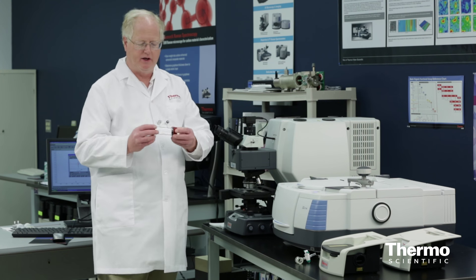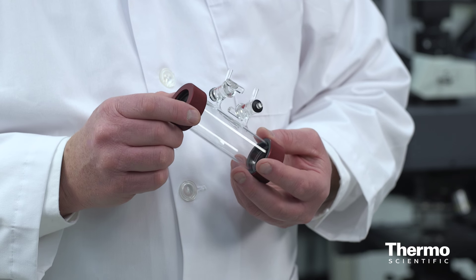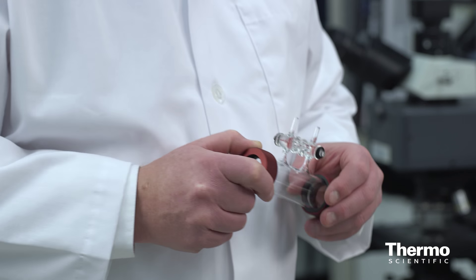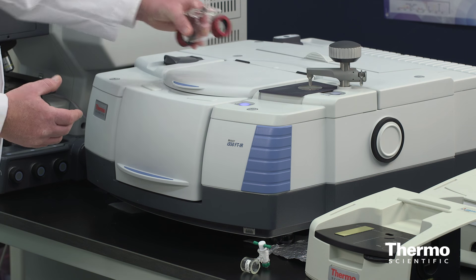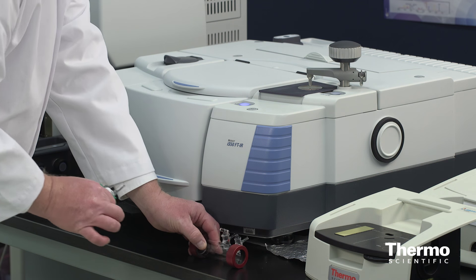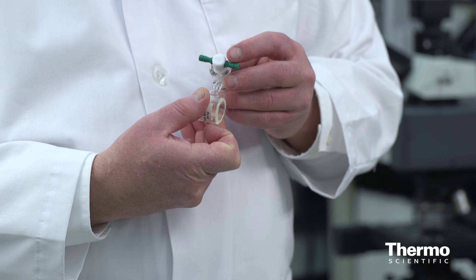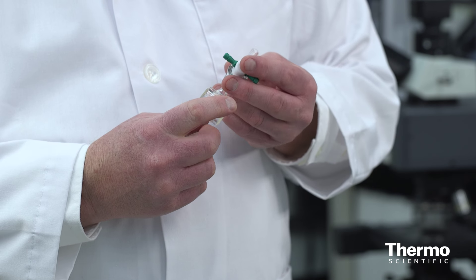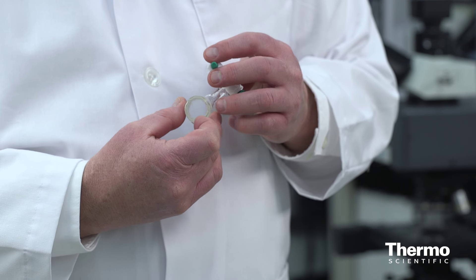We've already shown you this in the earlier video. This is the 10 centimeter gas cell — it's just a straight transmission cell you put right into the beam in a holder and the beam passes right through it. This is the cell we are going to use now: a two centimeter gas cell filled with carbon monoxide.